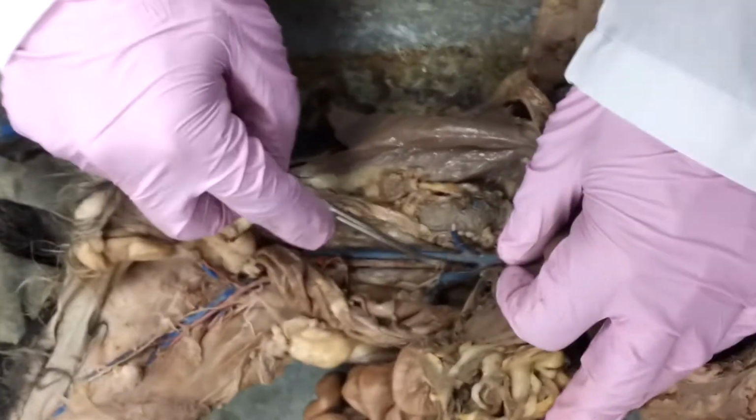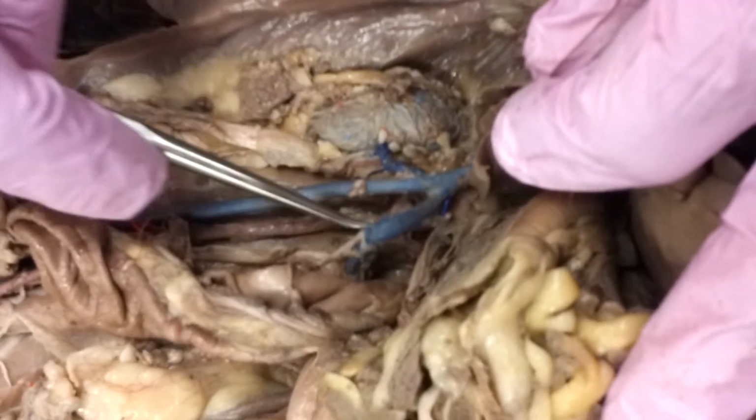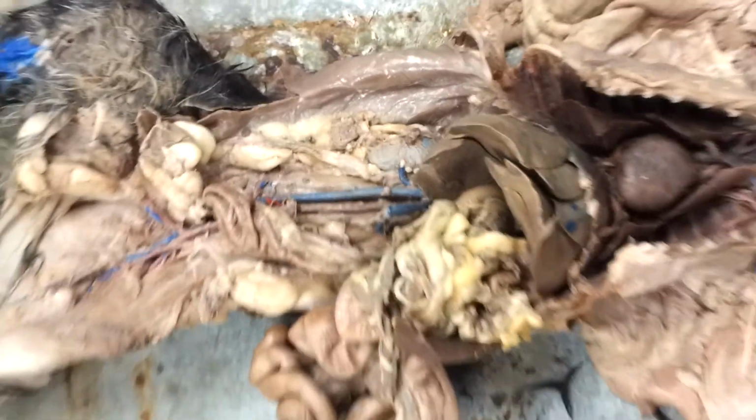But last thing here, take a look at these renal veins. When in doubt, always go to those organs and pull on them. Where they're going is what you're actually feeling. So, thank you for taking a look, and hopefully that's helpful.